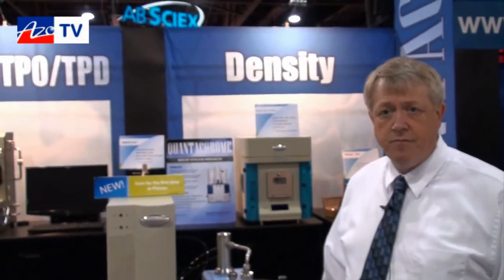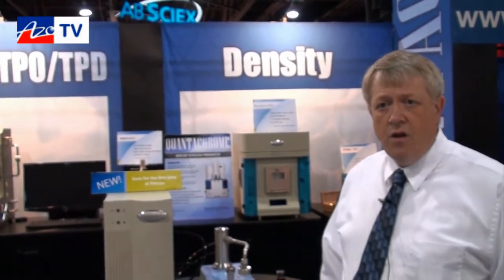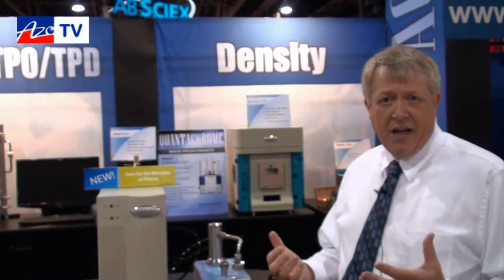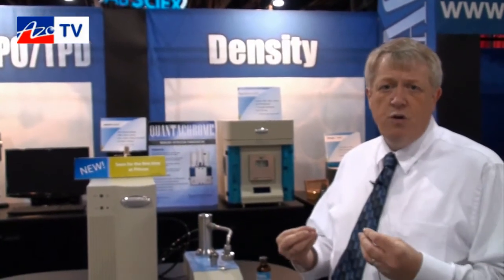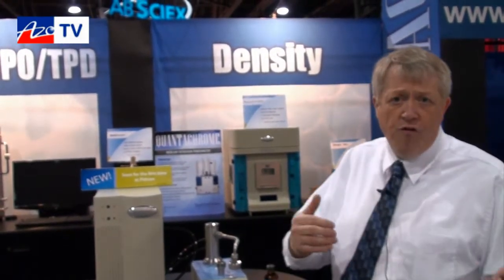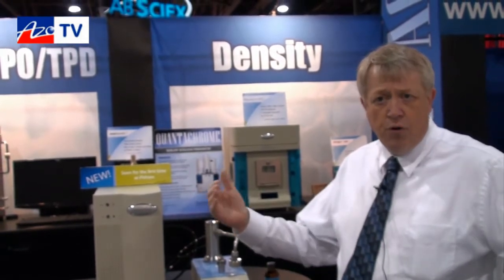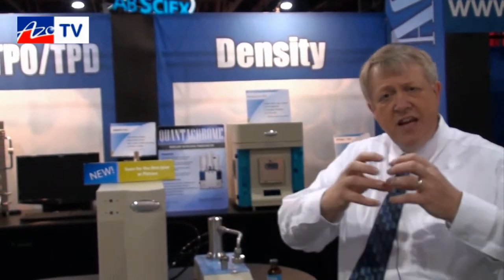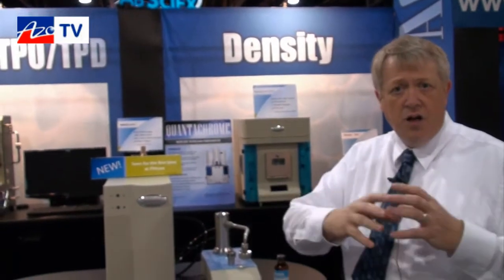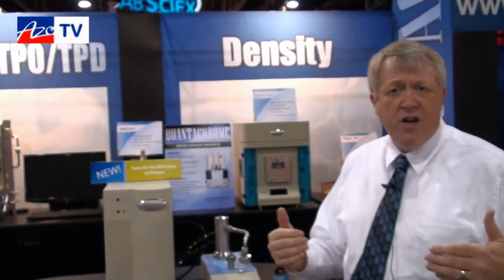Is this typically purchased by people in the research field or more in the industrial field? More in industrial applications, for those people who need to ensure quality of the product that they're making. These textiles — woven or non-woven — are very often made in broad sheets. They need to be sure that the homogeneity of the sample can be determined across the width of the sheet and across the length of the roll.